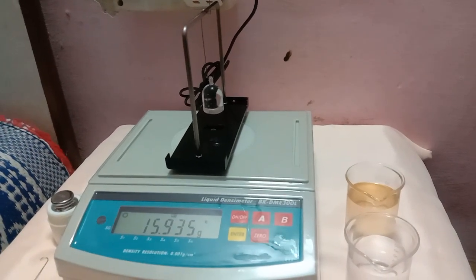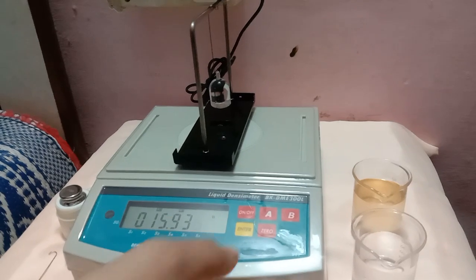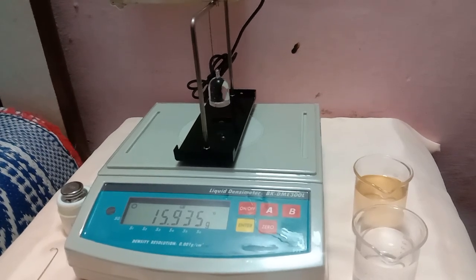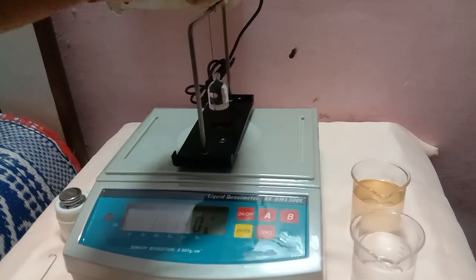Once you get those stable values, just press Enter and A to register the value. And again press Enter to feed the value. Now you have got this value — just remove it.